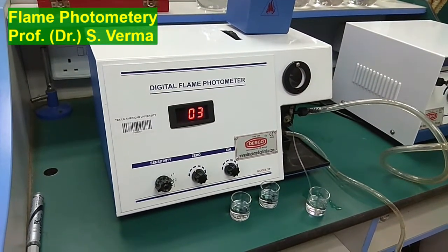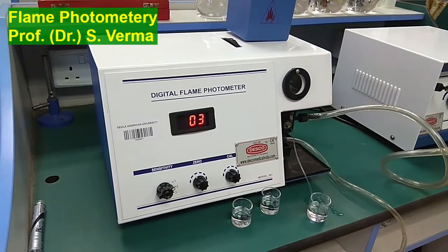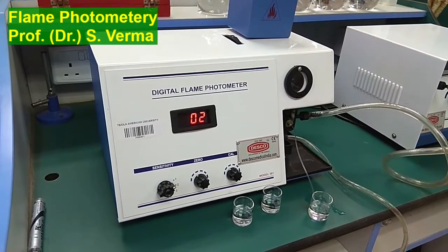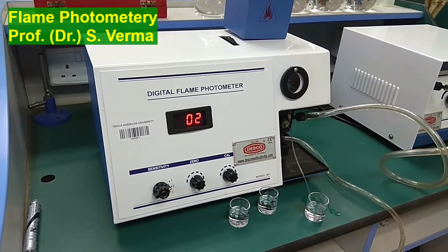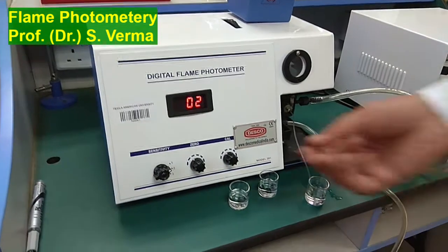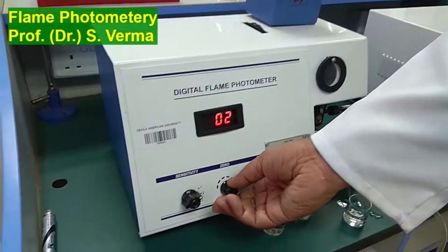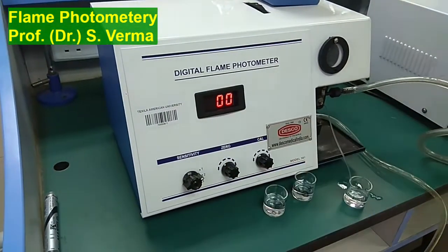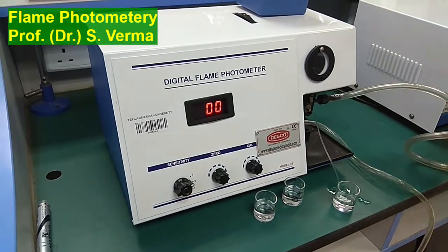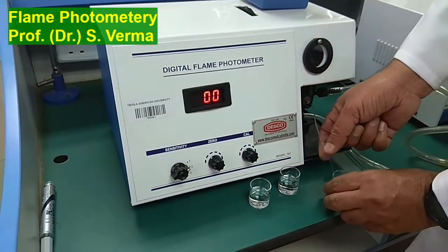So it should go back to 0 as we have to adjust it to 0. So you can see that this is stopped at 2, so we can use this 0 knob to bring it to 0. So now I'm ready for my potassium ion concentration measurement.